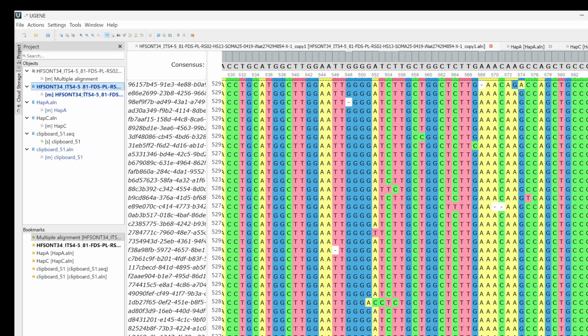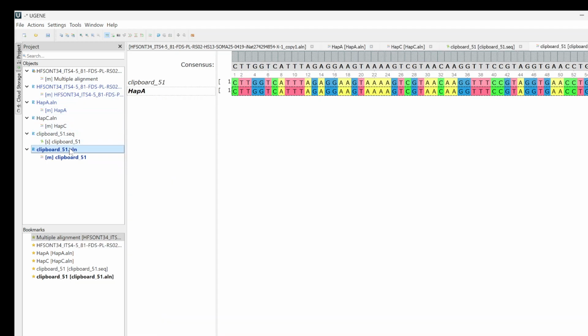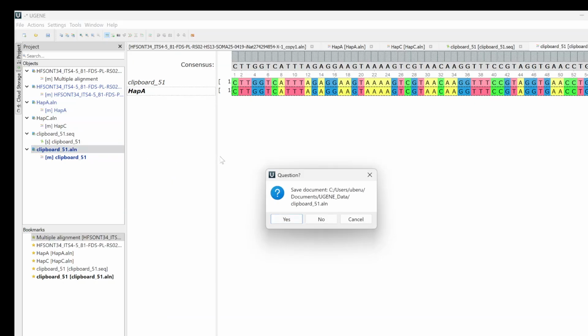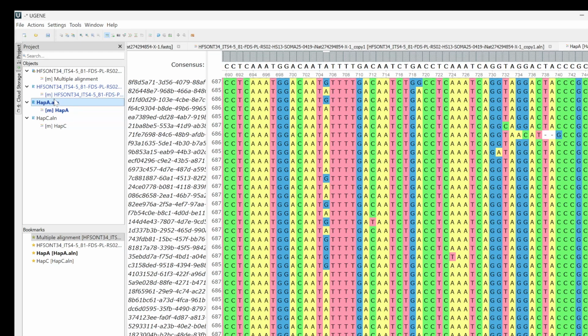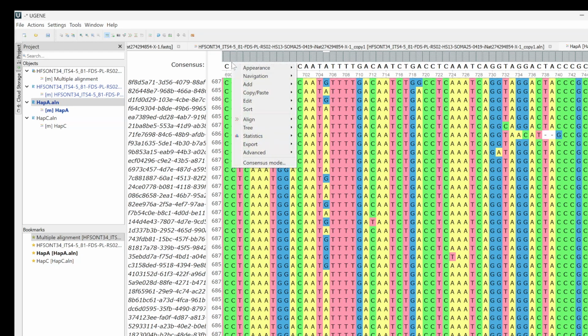Oh, now I'm confused. Let's just start over again. Talking and doing this at the same time, always fun. I'll just start with A and we'll make that real easy.